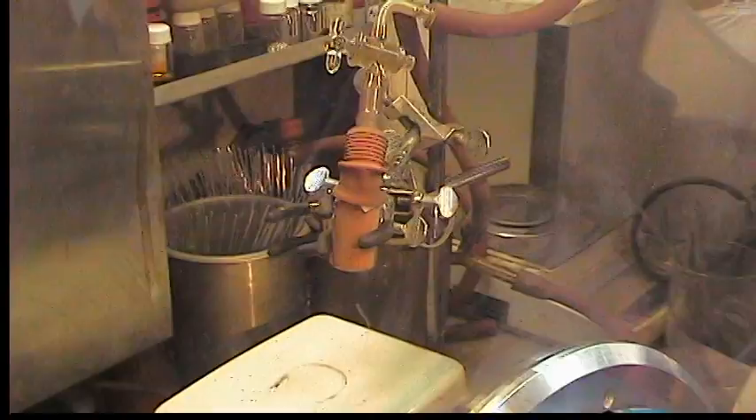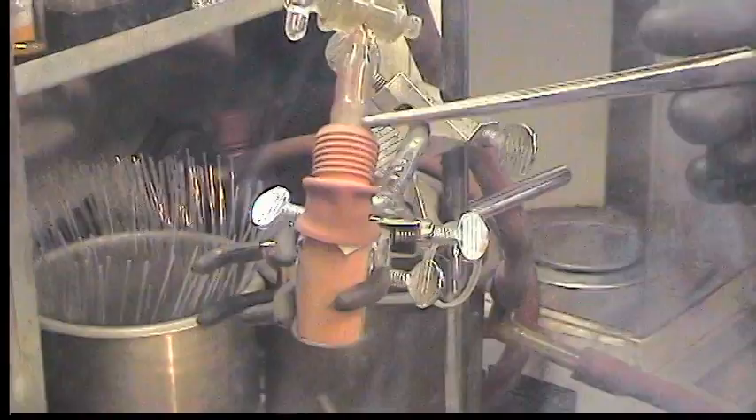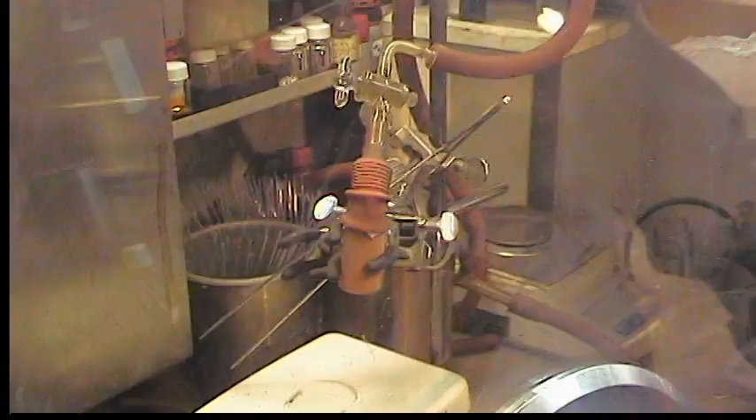The Kim Wipe is there just because with fine powders sometimes there's a problem with the powder getting pulled up into the glass. John, that was a great synthesis. We'll resume tomorrow for the next step in the prep of molybdenum trisanilide.